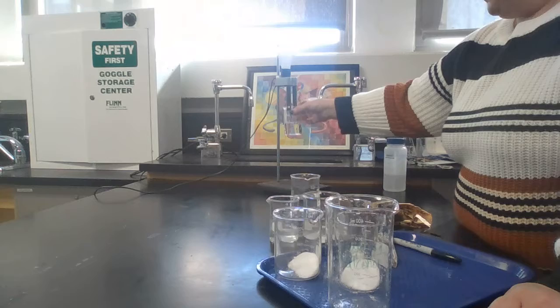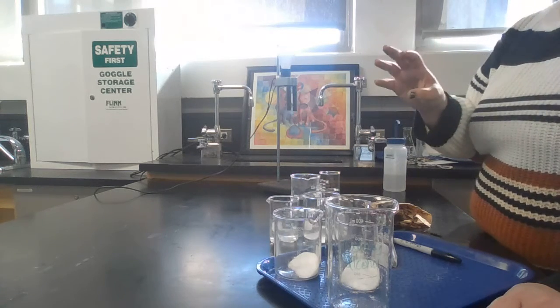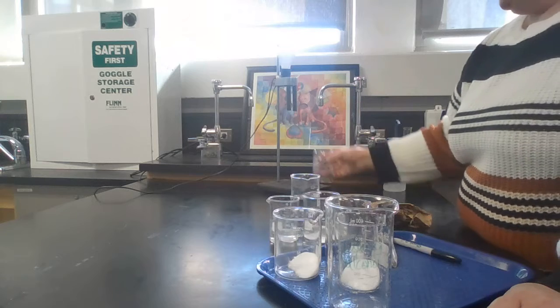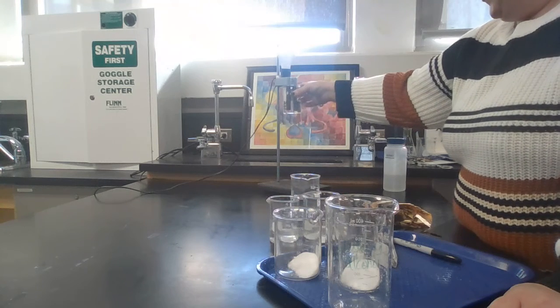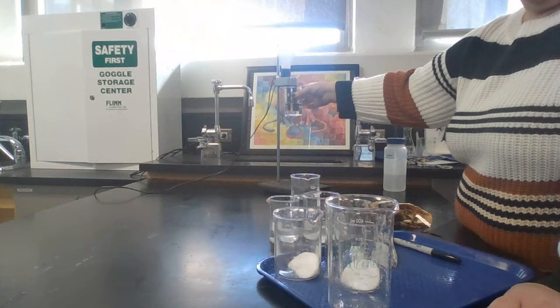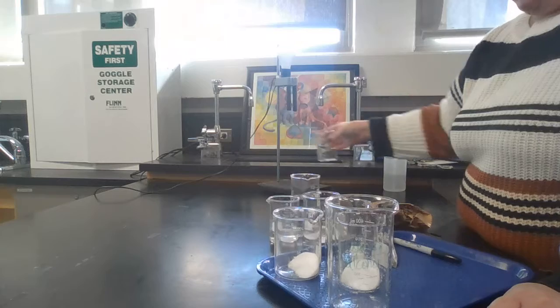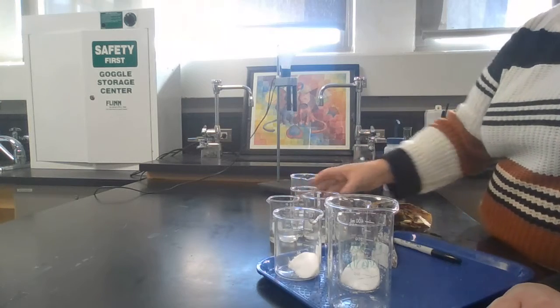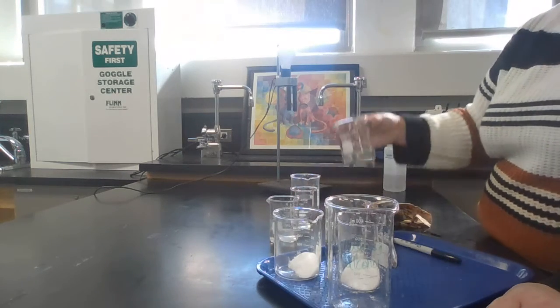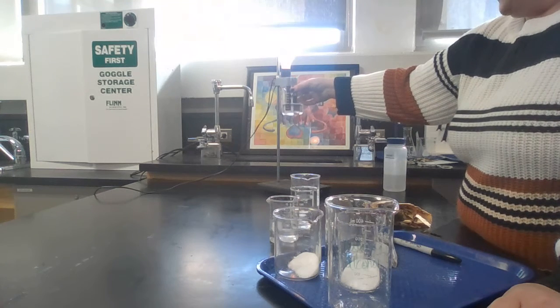So what you want to do is go up to this, which is a conductivity meter. There are 3 of them, so 2 tables each are sharing one. And you want to put your solution so that both of the probes are in the water. Okay, and if the light bulb lights up, then you write it conducts. If it doesn't, then you don't. So you want to do that for each one of them. You can see that one lights up.